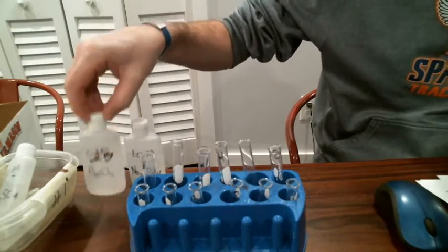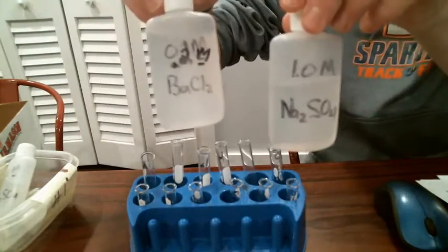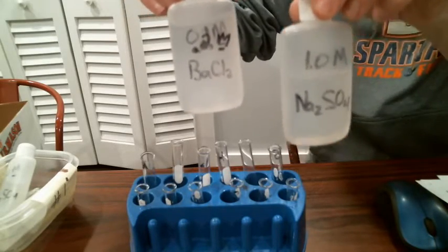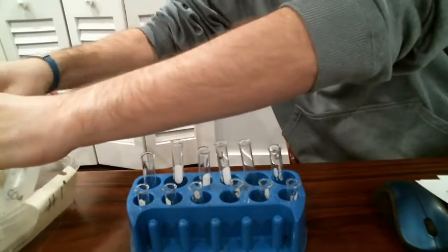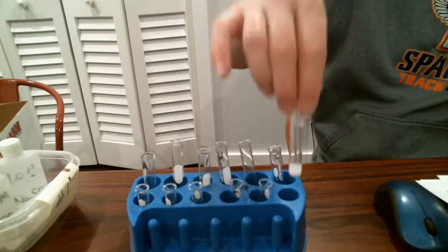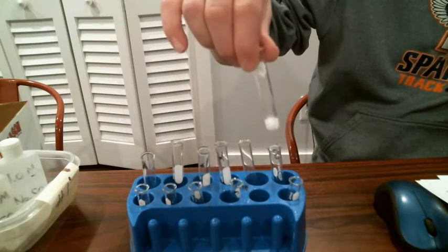where again you could see for the examples that we had, like for number one was barium chloride and sodium sulfate. We were mixing two aqueous ionic compounds. And if the reaction occurred, so in other words, if we had the formation of that precipitate, the reaction occurred.